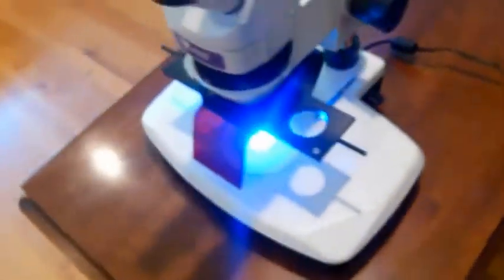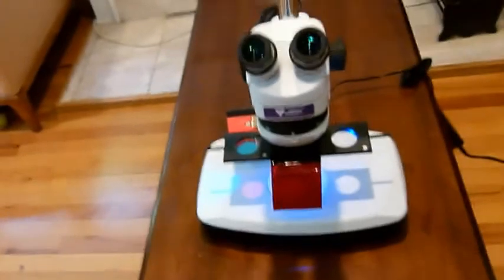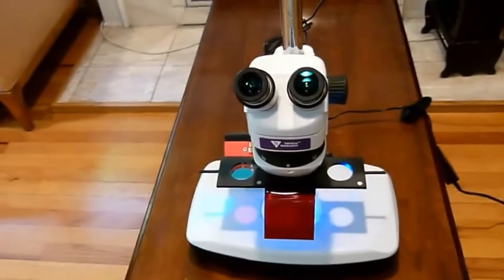And that's pretty much all there is to it. Thank you very much and enjoy your microscope.